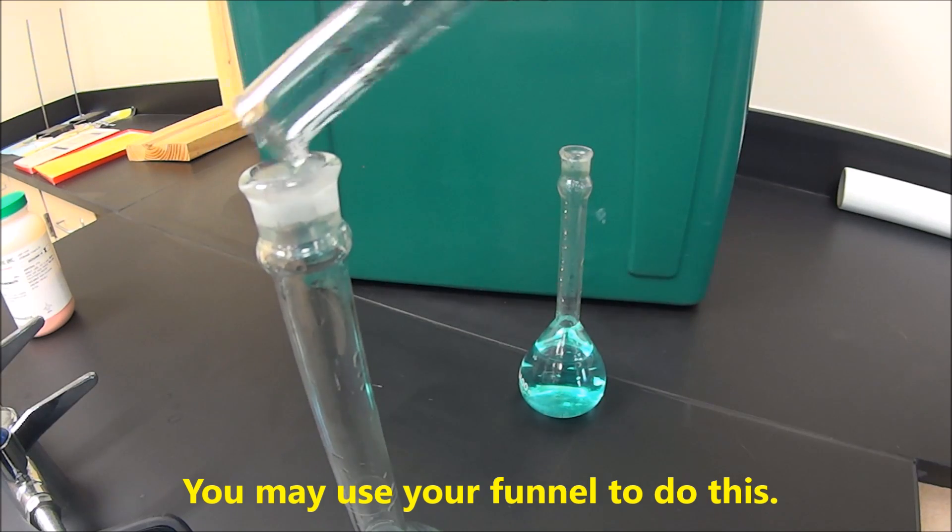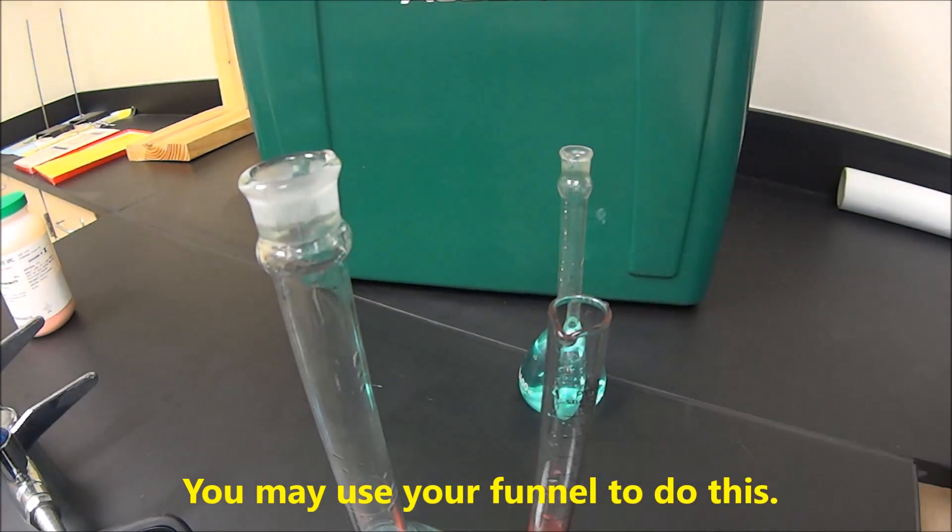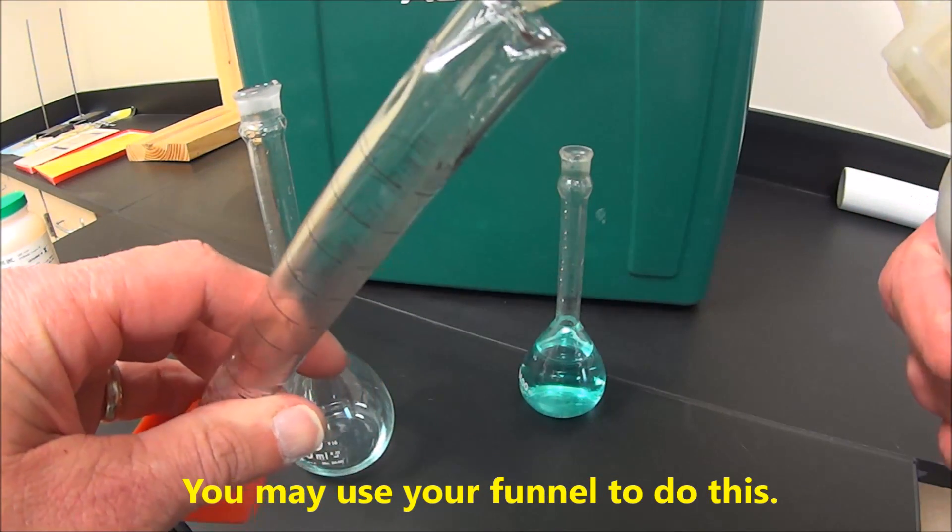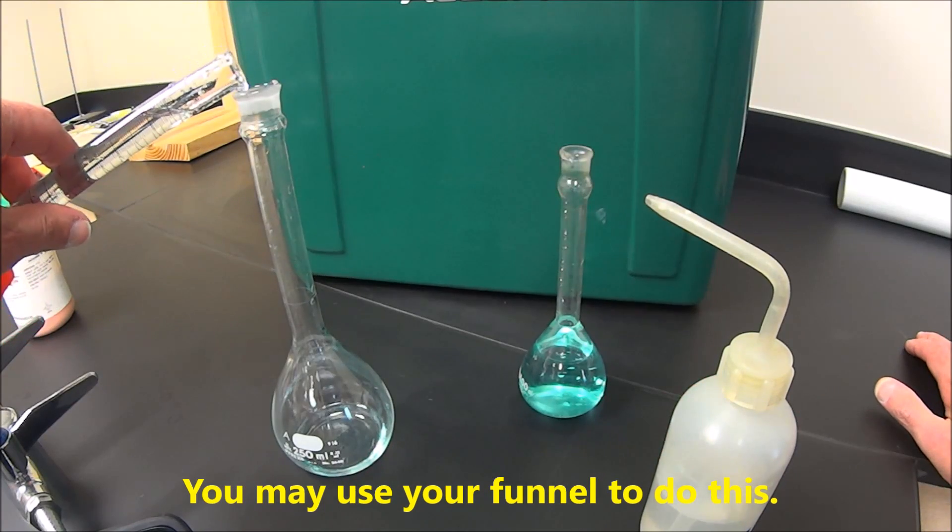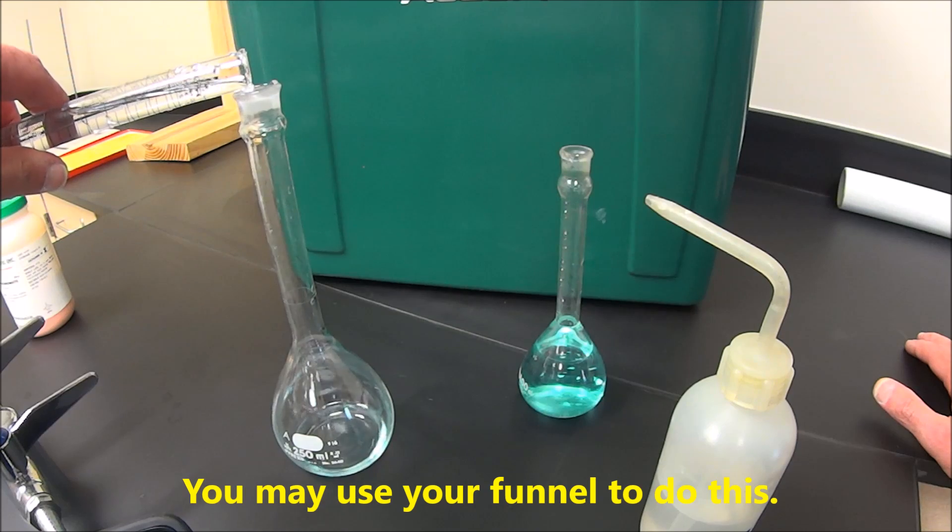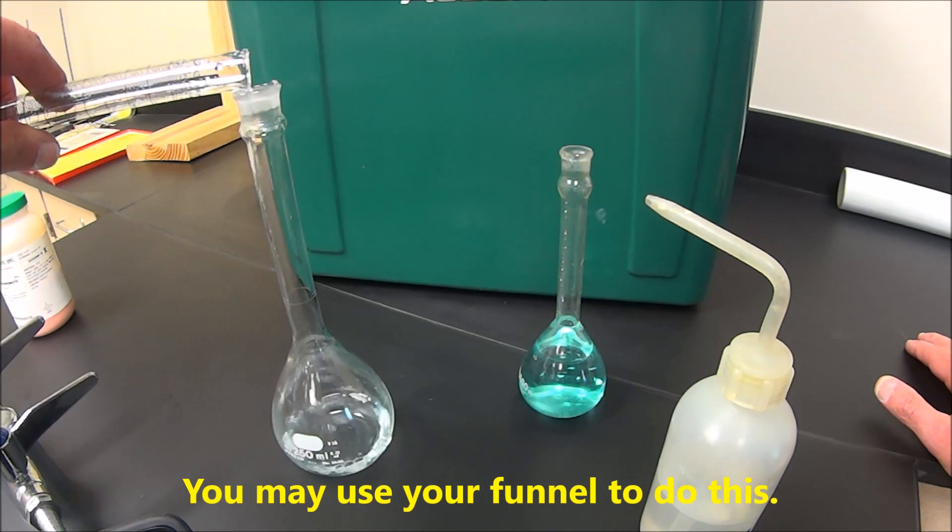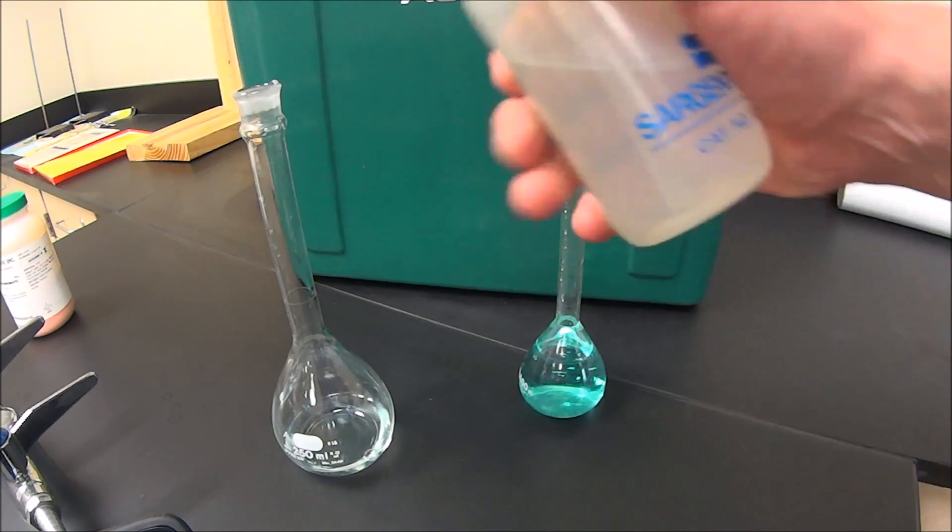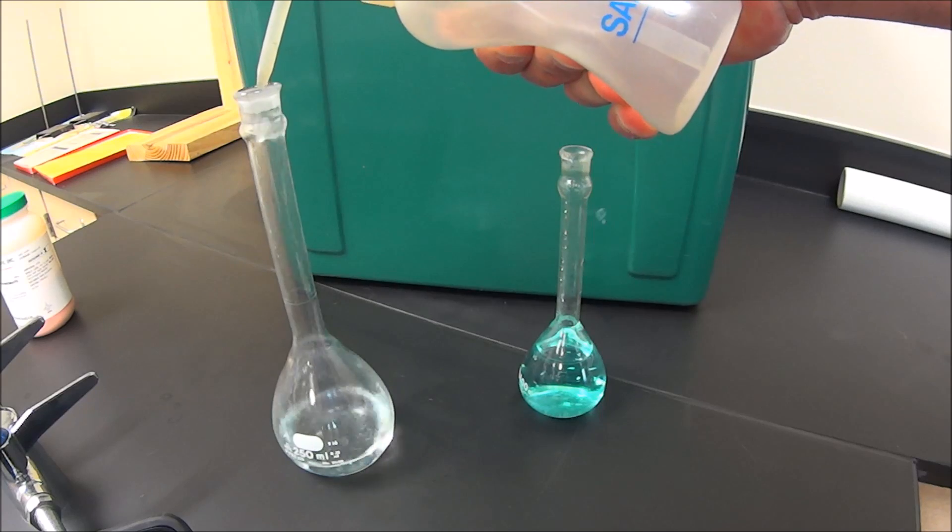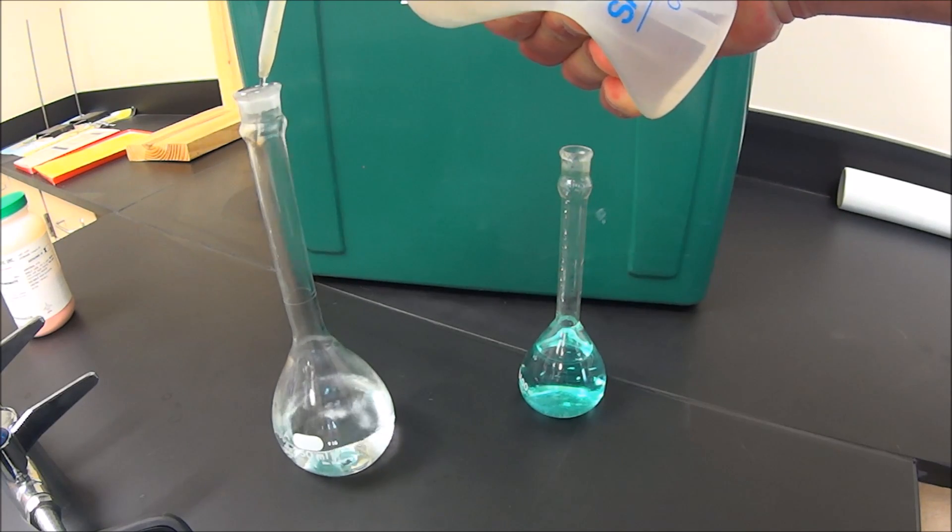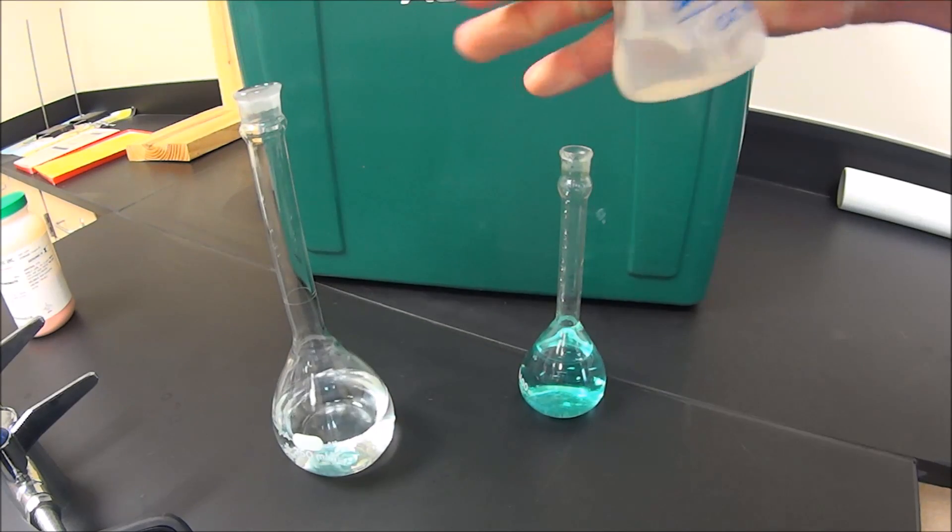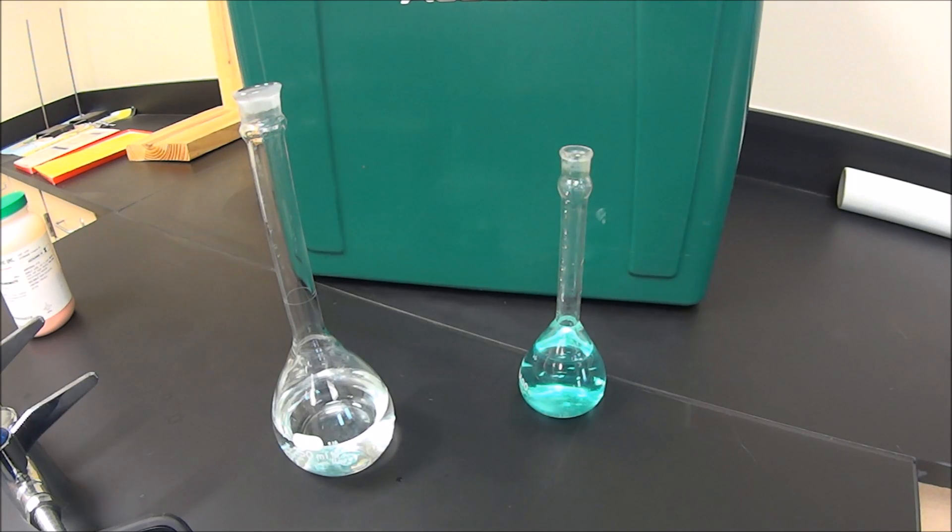And it probably wouldn't be a bad idea, just for kicks and giggles, to rinse out our graduated cylinder, since I'm sure you'll have some of those particles in there. And again, it's just distilled water. So we pour that in there. It's actually a good thing, good practice. All right, so now what we're going to do is we're going to top this off to 250 milliliters. Hopefully I have enough water.